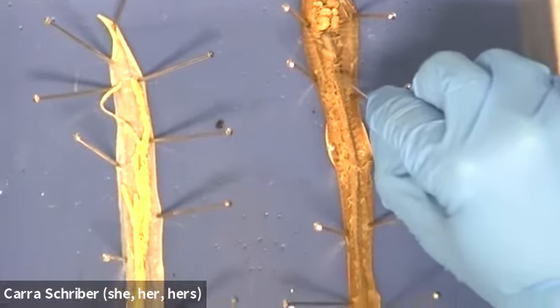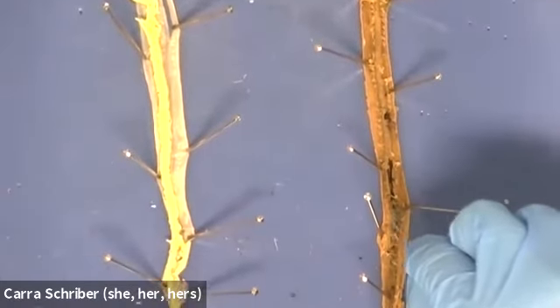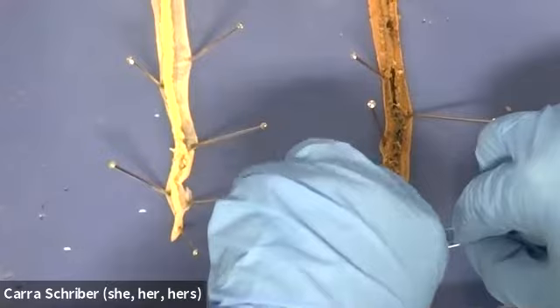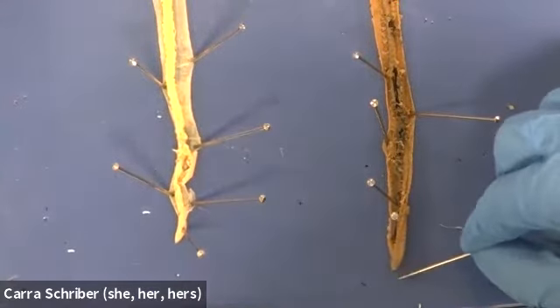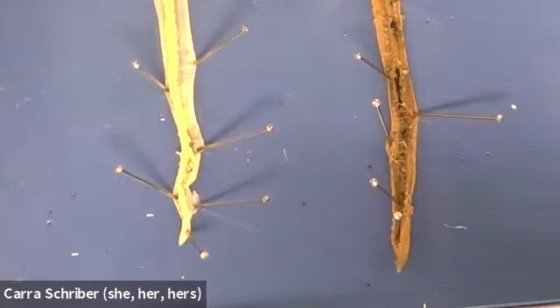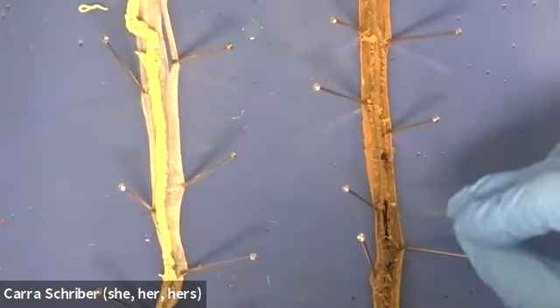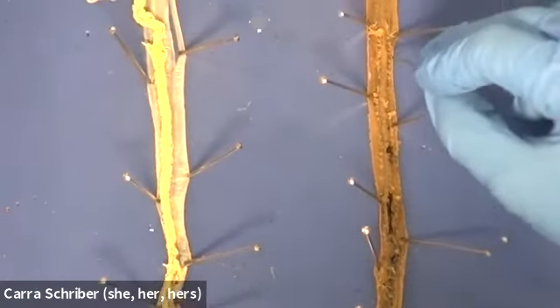And the intestine is going to run the entire length all the way down to the very end, at which point waste would exit through the anus. And actually, if I pull this pen, you can kind of see, well, I can see it, and we'll see if you can see it in the video. There's a hole at the end, right, which is the anus. That's where the waste would be excreted out through. You'll notice that the intestine, even though it runs the entire length, has some different characteristics here. And I just wanted to be clear with you that this is the intestine.